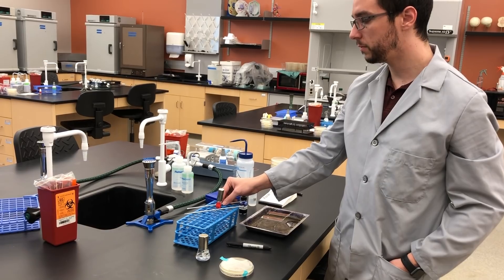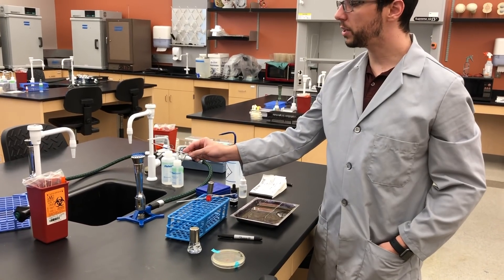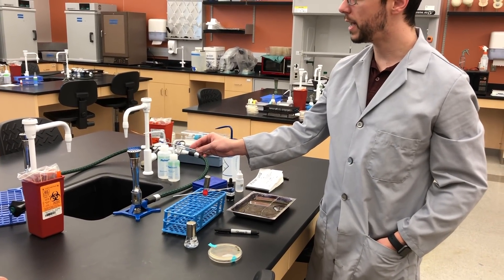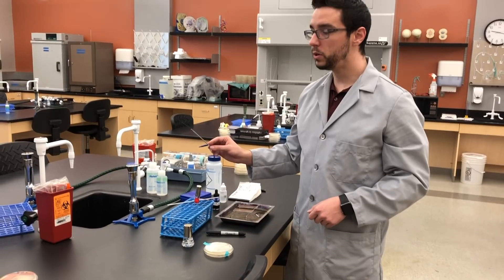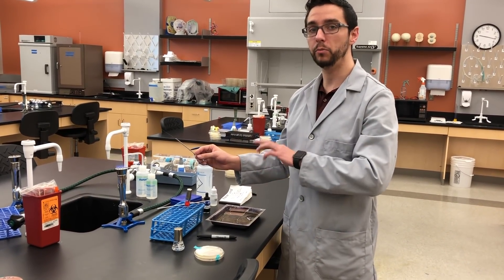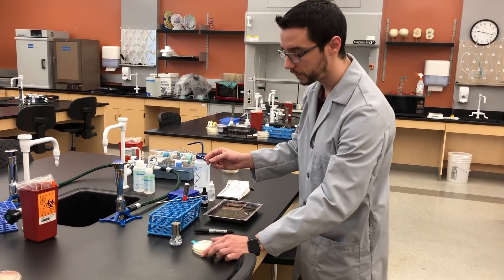Be careful where you set it down because it's still hot while it cools. Now we're going to sterilize our needle — this is what we're going to use to collect our colony culture from the plate. The reason why we use a needle is so that we don't remove the entire colony. We want to leave a majority of the colony behind so we can come back and test it again later or use it for another culture.